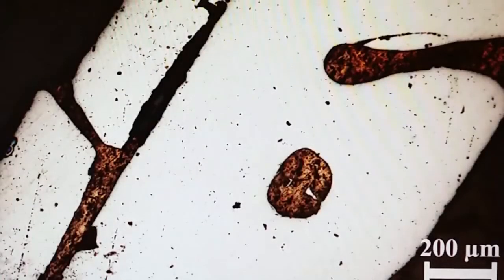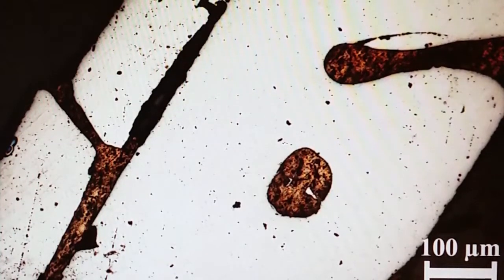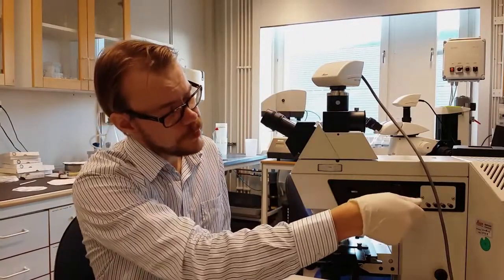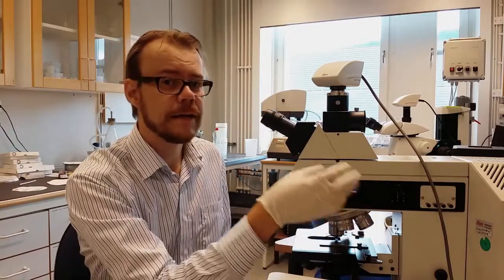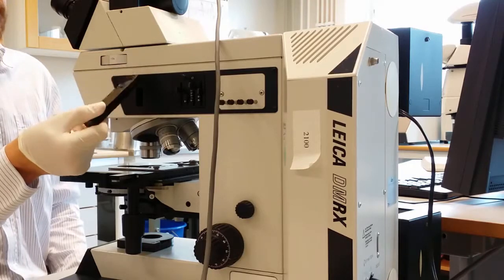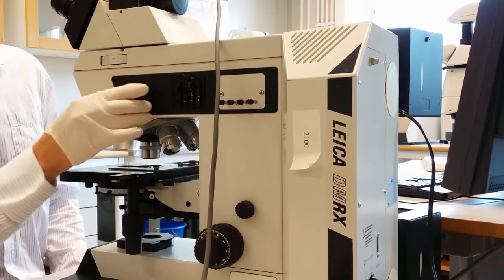We can switch back to the bright field view. Here you see that the silicon surface becomes very white because now it picks up all the light that's reflected back. So this is the standard bright field image. So all things you see here on the microscope, these ones at the top for example, those are for the reflected light option. This piece you choose the differential interference contrast option with.